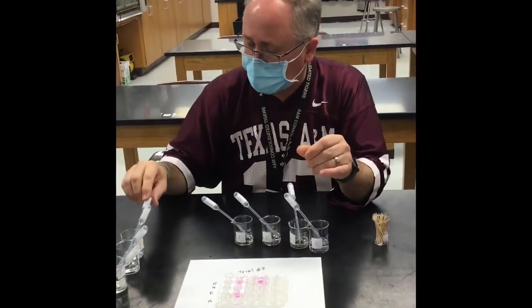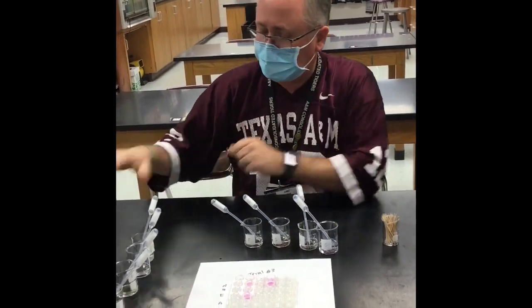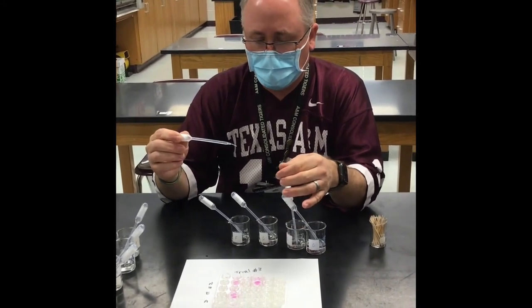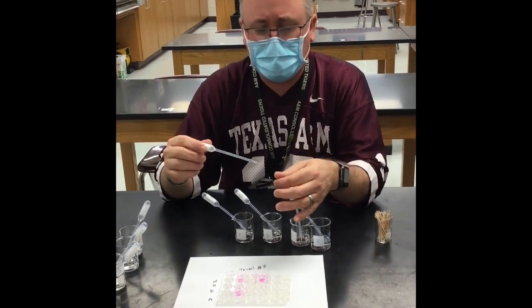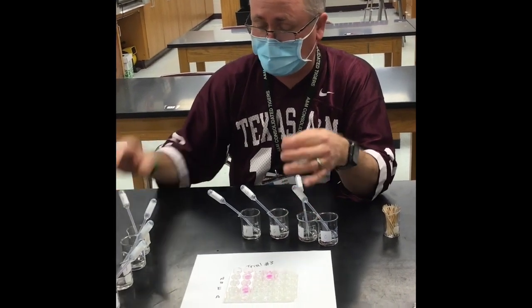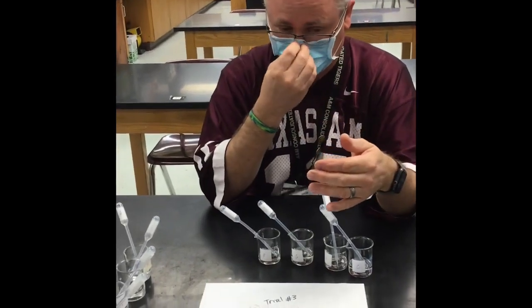I'm also going to take a little bit of the A. Let's look at A real quickly. I'm going to put a little bit of A on my finger and feel. That's crazy slippery. That one is a little bit more. I'll go wash my hands in a second. Yeah, the A is crazy slippery. There is no odor to the A whatsoever.